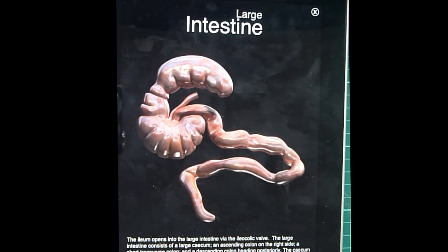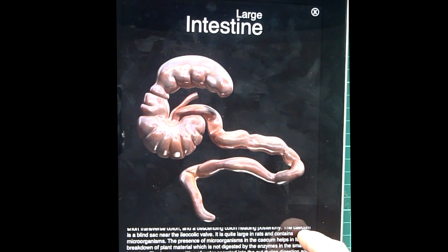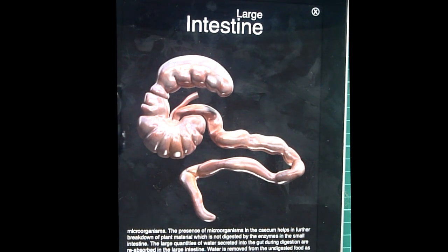The presence of microorganisms in the cecum helps in further breakdown of plant material which is not digested by the enzymes in the small intestine. The large quantities of water secreted into the gut during digestion are reabsorbed in the large intestine. Water is removed from the undigested food as it moves along the colon.